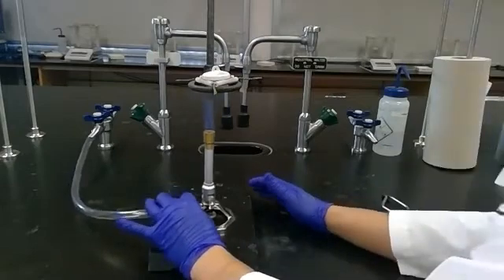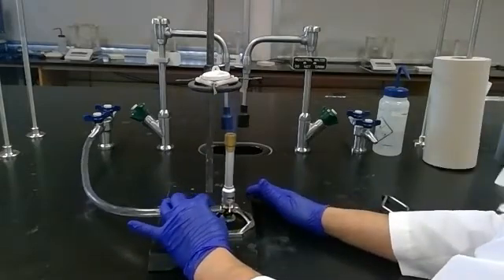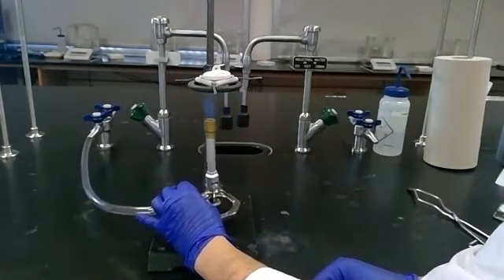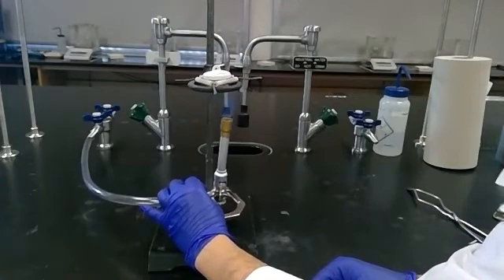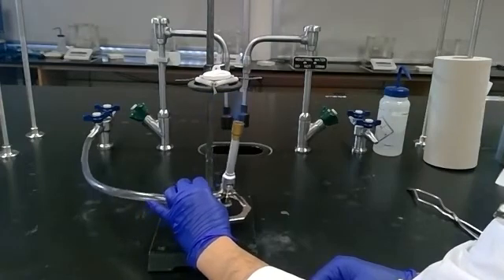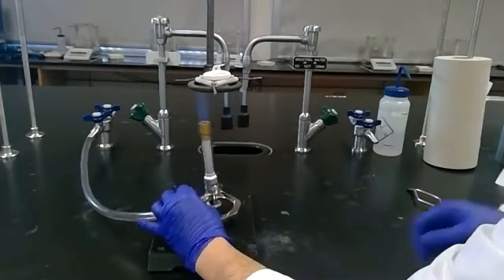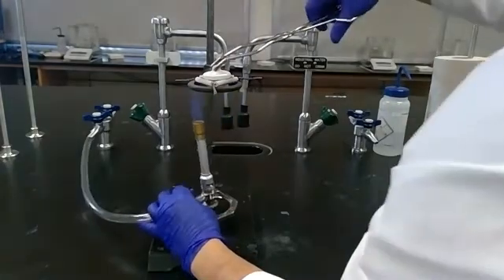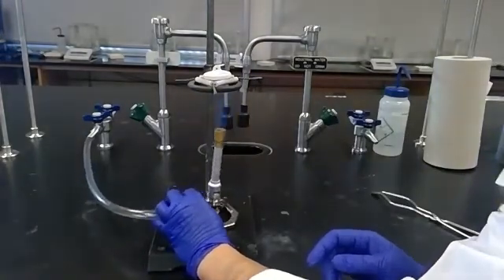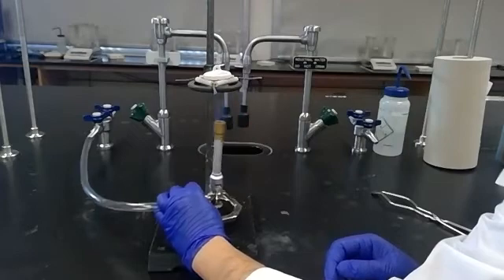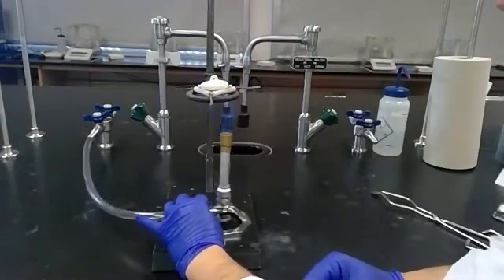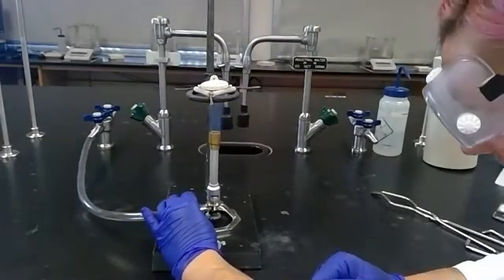I've been waving this flame under the crucible for about one minute, and I'm starting to hear a little fizzing sound coming from the crucible, which means it's probably starting to be hot enough to bubble. I will use these crucible tongs to check—oh yeah, it's still bubbling. I'm going to keep heating gently for a little bit longer. I have heated this gently for about two minutes.